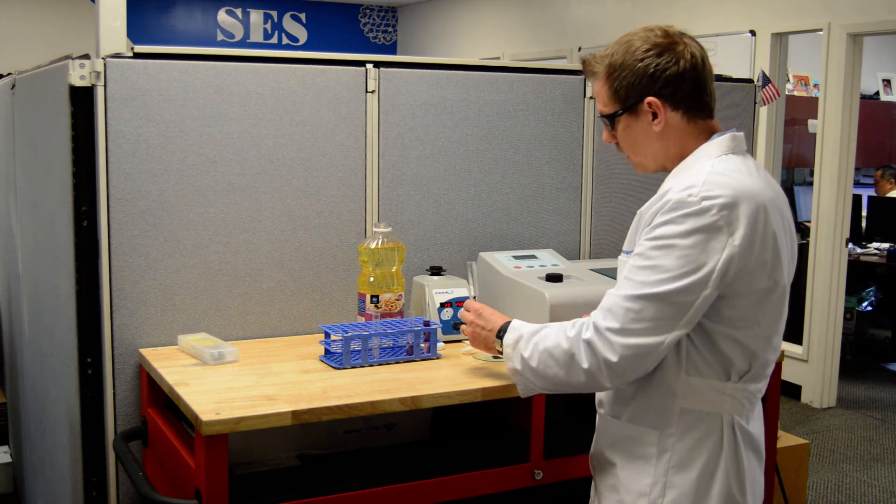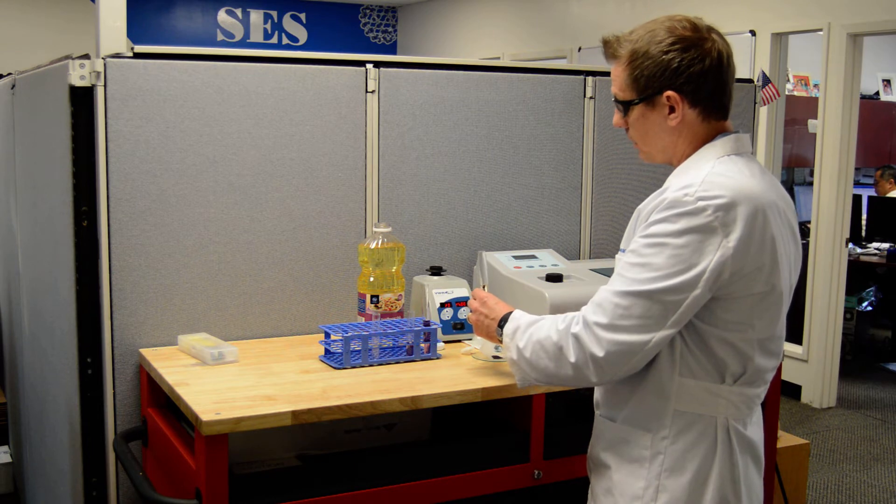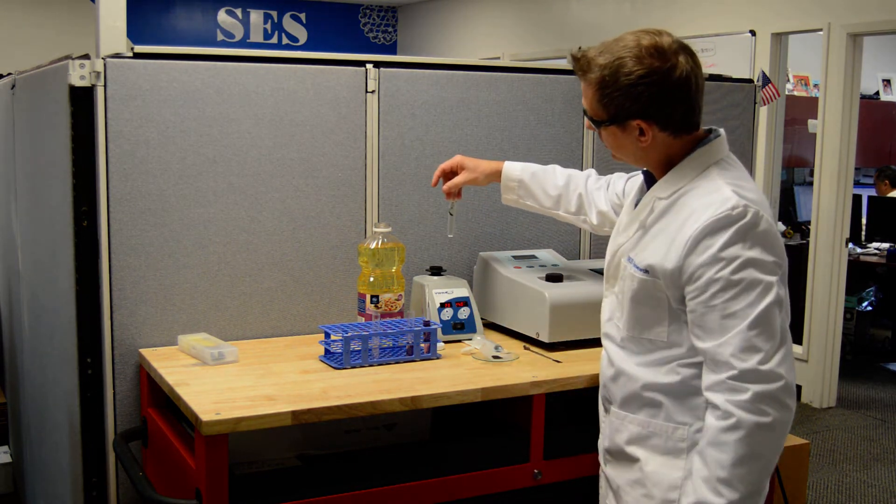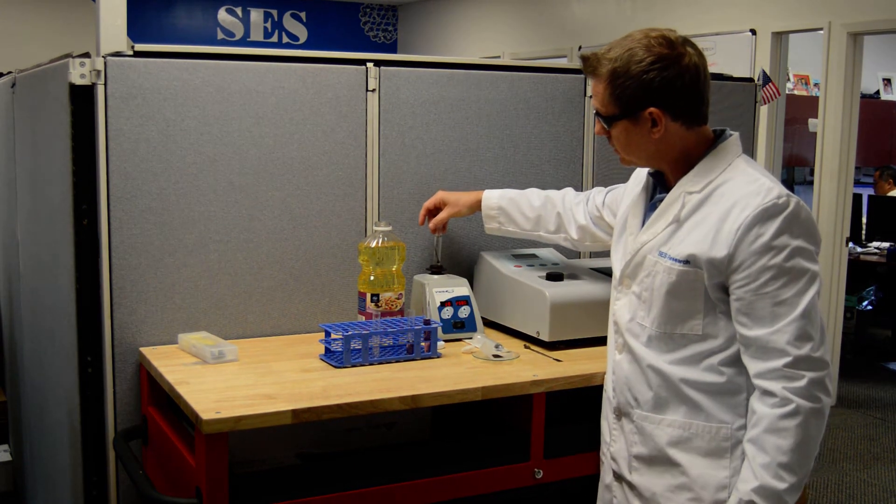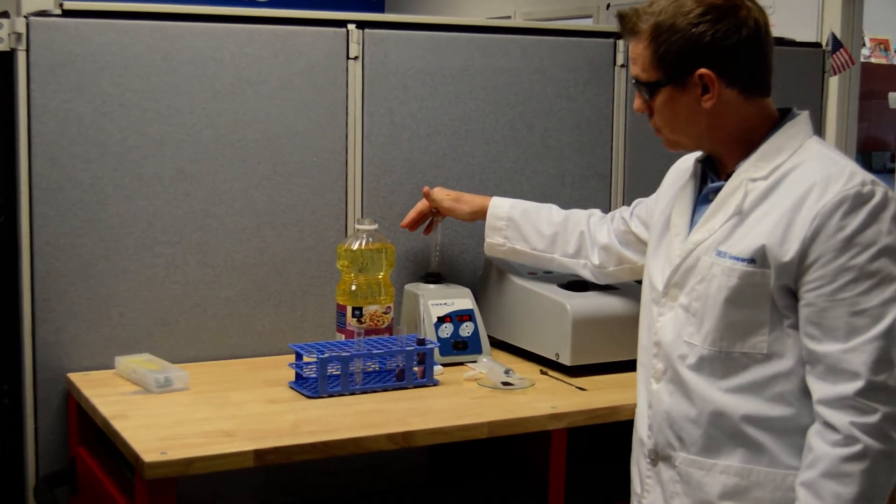All right so now I'm going to mix this in this vortex mixer and you can see the C-60 going down there. I'm going to mix this in this vortex mixer. So the vortex mixer is good.